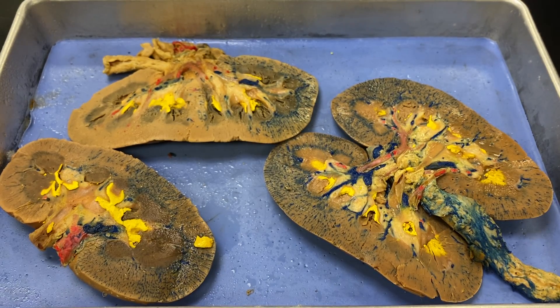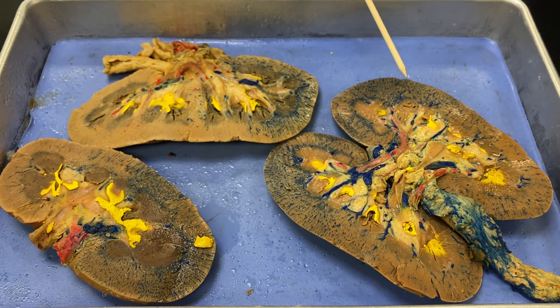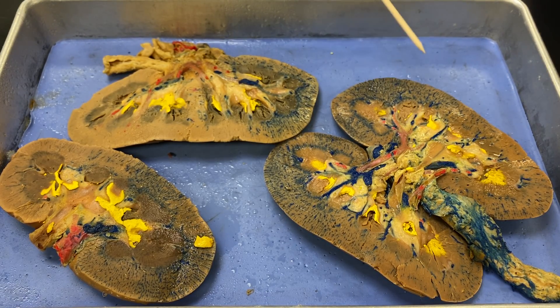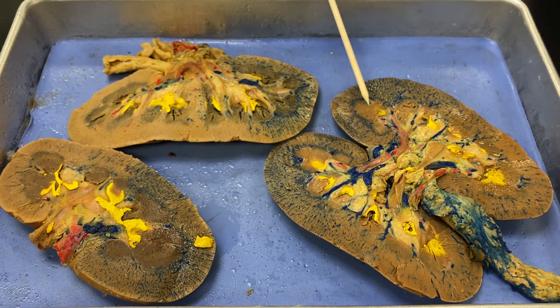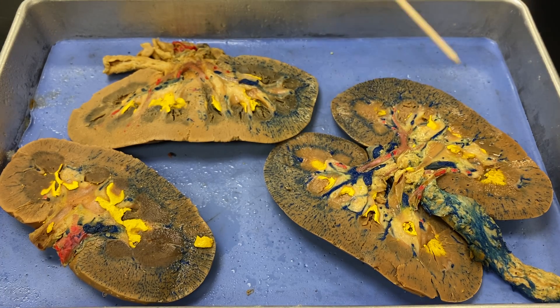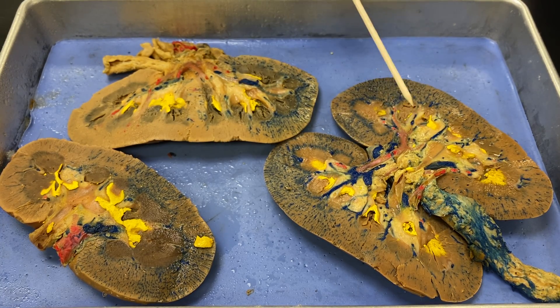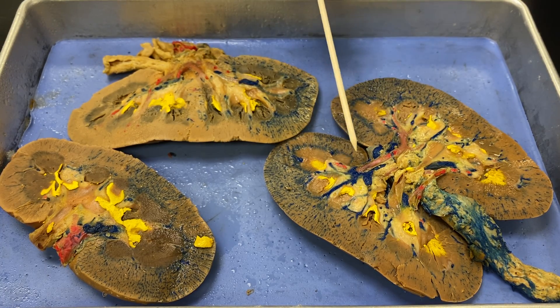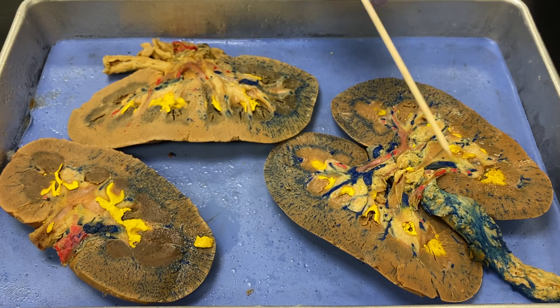All right, we're back to a real thing. This is a kidney — a sheep kidney. They donated it for science, and that's very nice of them. It's been injected, so you can see the difference between the arteries and veins.